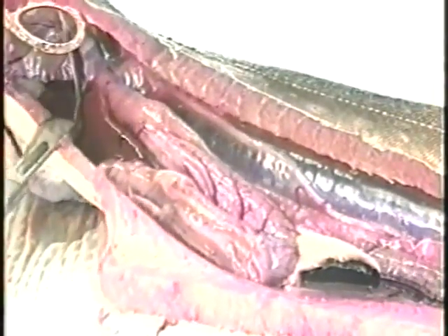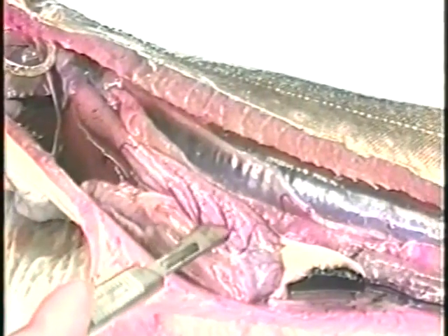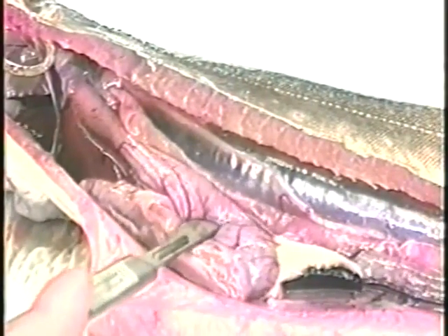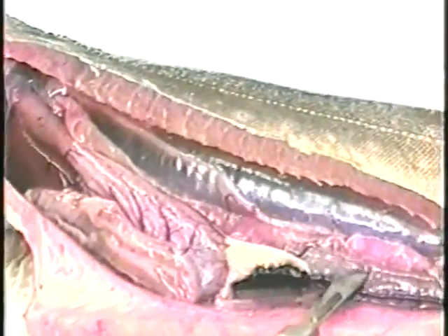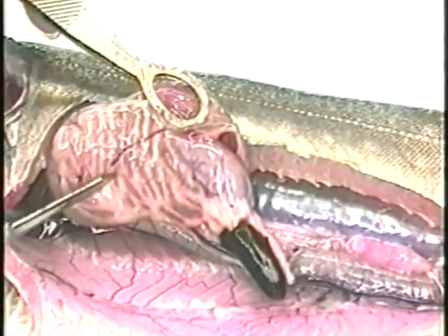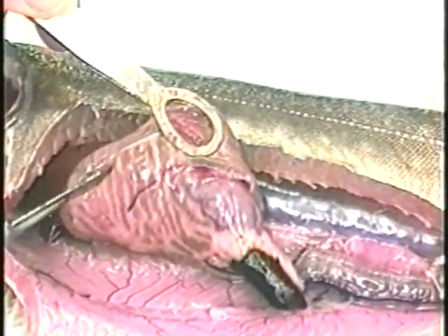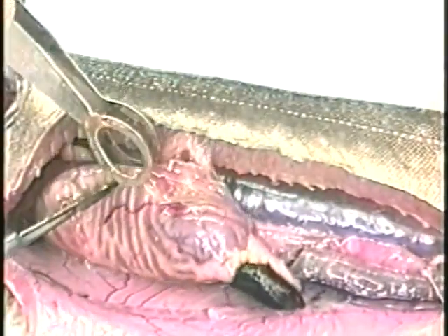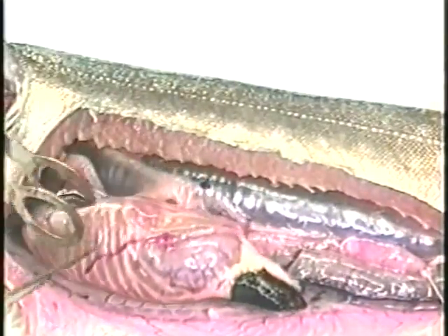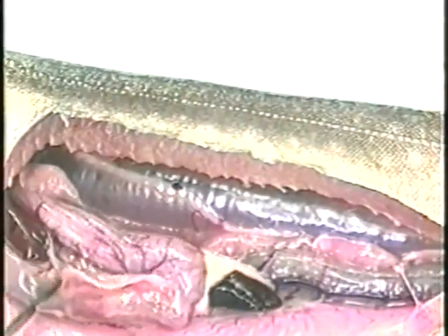First, examine the internal organs and the musculature. The digestive tract includes the esophagus, which extends from the oral cavity to the stomach, the muscular stomach, and the intestine. The pyloric ceca are finger-like outpockets of the digestive tract and are surrounded by adipose tissue and pancreatic cells. Abnormalities that should be noted include fluids, excess mucus in the intestine, and hemorrhages.